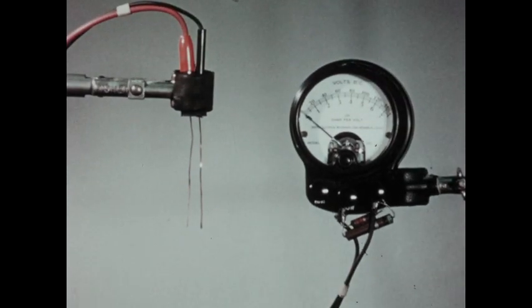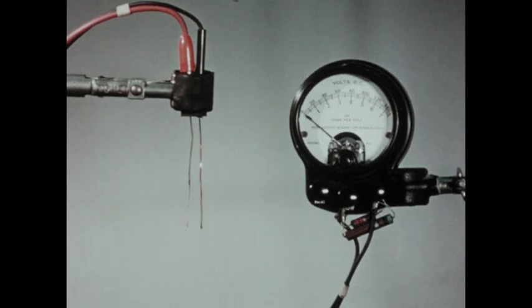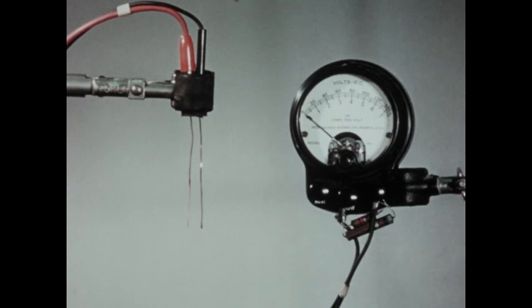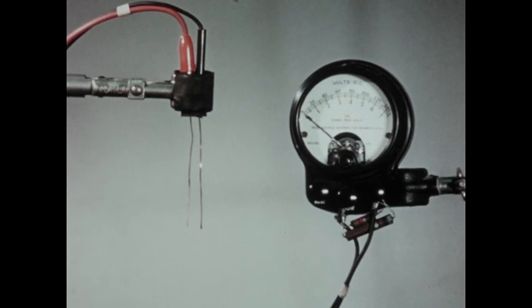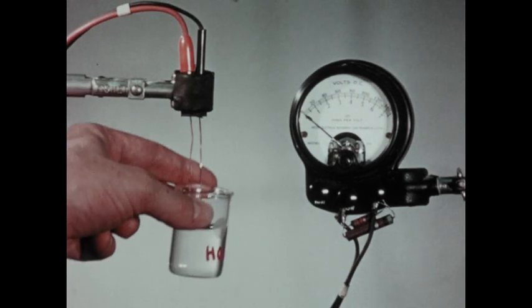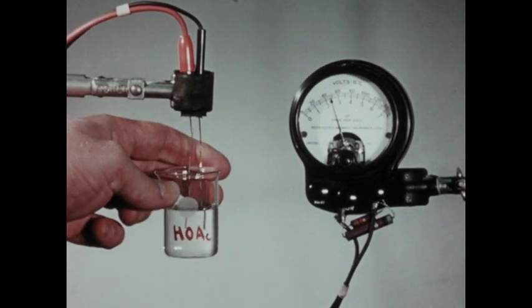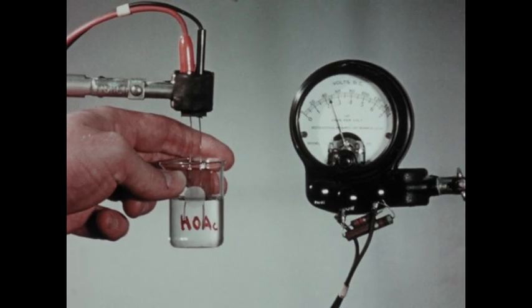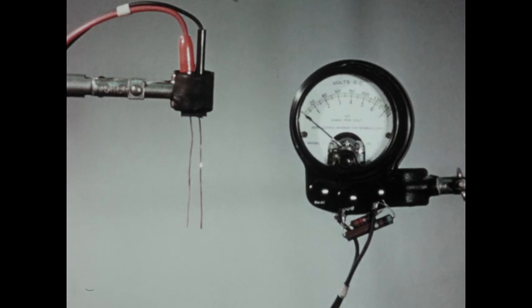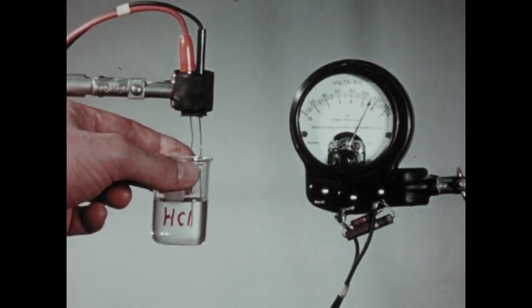First, we wish to examine the conductivity of solutions of two acids—acetic acid and hydrochloric acid—and then see how the differences in conductivity have implications in other sorts of chemical reactions. In this beaker, we have a solution of acetic acid, about six normal. You can see that it has some conductivity, but not very much. We'll then replace this with a solution of six normal hydrochloric acid. You see the conductivity is substantially greater.